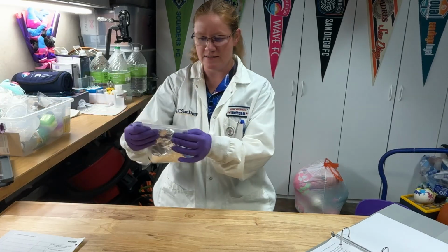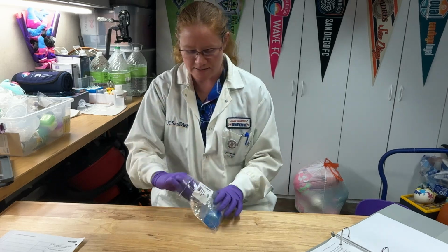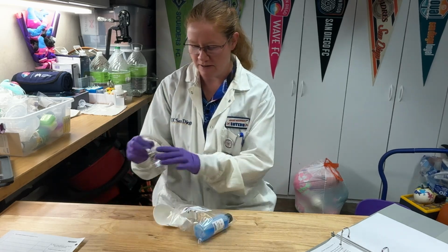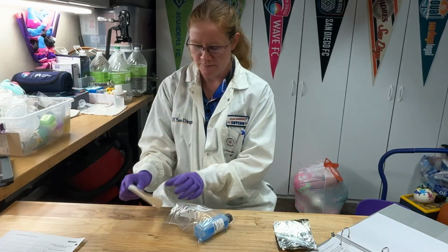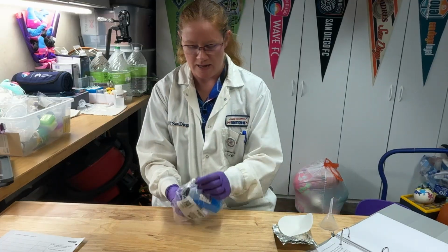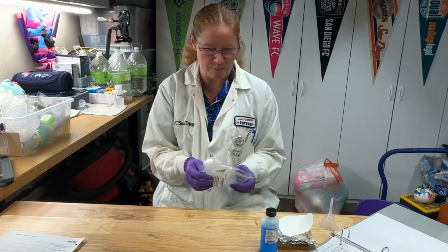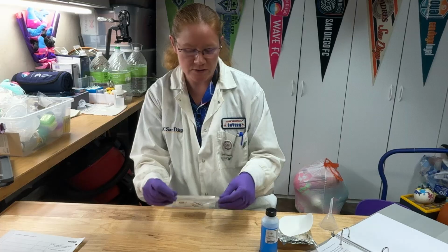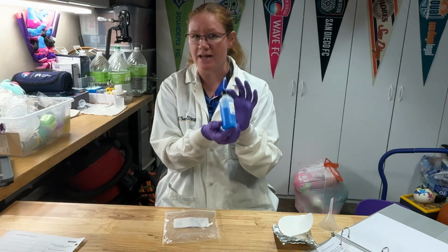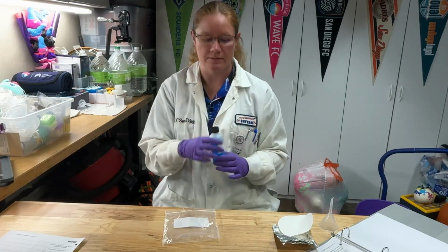All right, so for this reaction, you're going to need your materials kit that is going to be listed single replacement reaction, stoichiometry, and percent yield. Inside of this materials kit, you will find some foil, a couple filter papers, a funnel, and this blue bottle here, copper 2 sulfate. It's approximately 1 molar. You can see it's this nice, pretty blue color. The blue color is coming from the copper 2 ion.